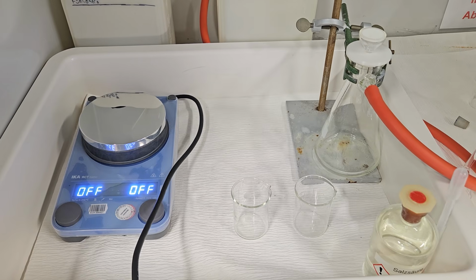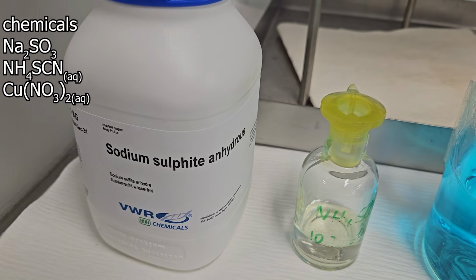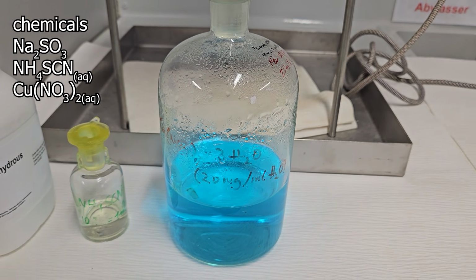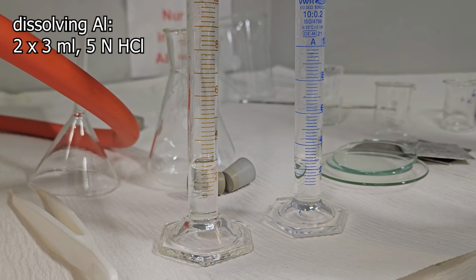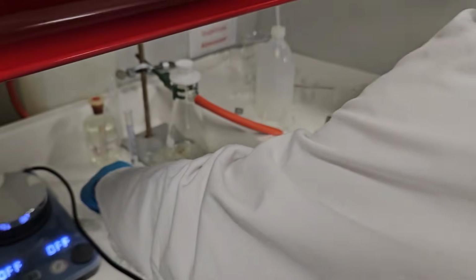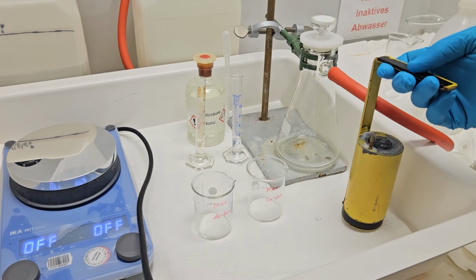At the workstation we need a hot plate, 2 beakers, a funnel, hydrochloric acid and some other glassware. As for chemicals, we need sodium sulfite, ammonium thiocyanate solution and copper nitrate solution. We compare the irradiated aluminium foil with a copper standard. Accordingly, 2 batches are to be prepared. Here we have 3 ml of 5 molar hydrochloric acid, or 5 normal, which is the same in this case. Always label the containers, otherwise everything will look the same later on and you will be confused.